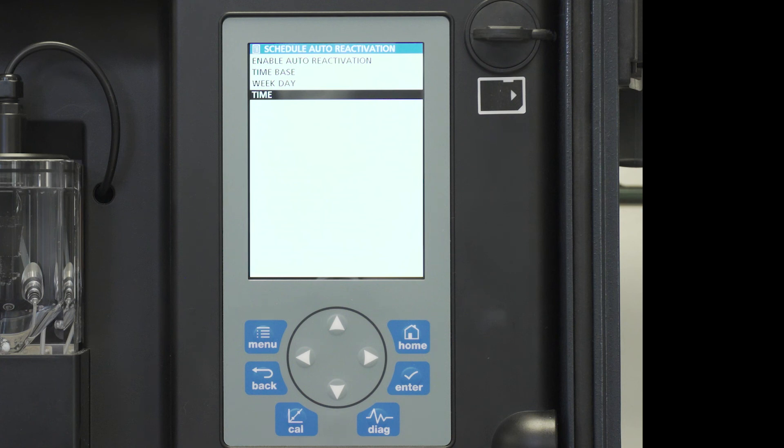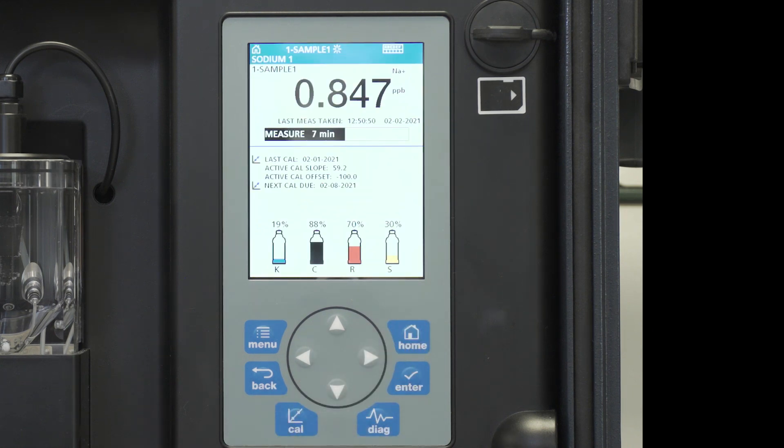The instrument is now set up to automatically reactivate on Mondays and Thursdays at 1 a.m. in the morning. Press home, and we move back to the main screen.